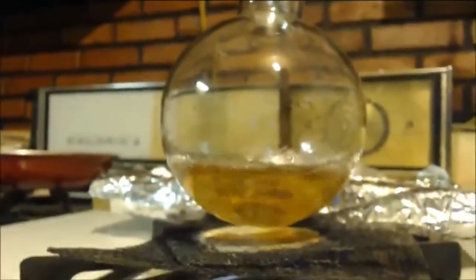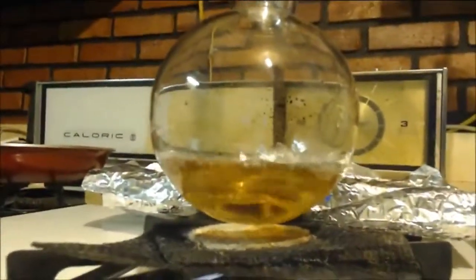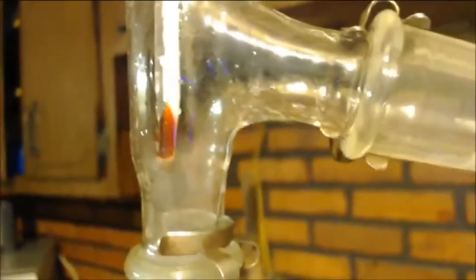Like I said, I've got about half there. Probably half there. Got a pretty good shot of that front. Oh, got a little blast there. So you can see how it's just barely going over.